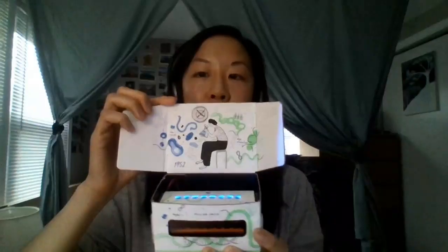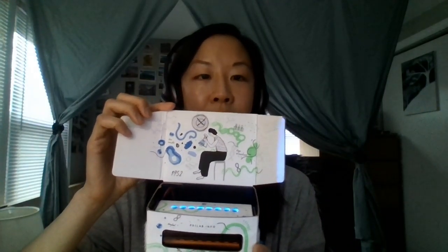So P51 stands for Photograph 51. This is actually our tribute to Rosalind Franklin. Photograph 51 was Rosalind Franklin's X-ray crystallography photograph that really helped contribute to determining DNA structure and the fact that it was a double helix. Since this was such a huge visual contribution to the history of molecular biology, for our visual molecular biology labs, we decided to name this after her. In fact, if you open this up, we actually have a little picture of Rosalind Franklin in here.